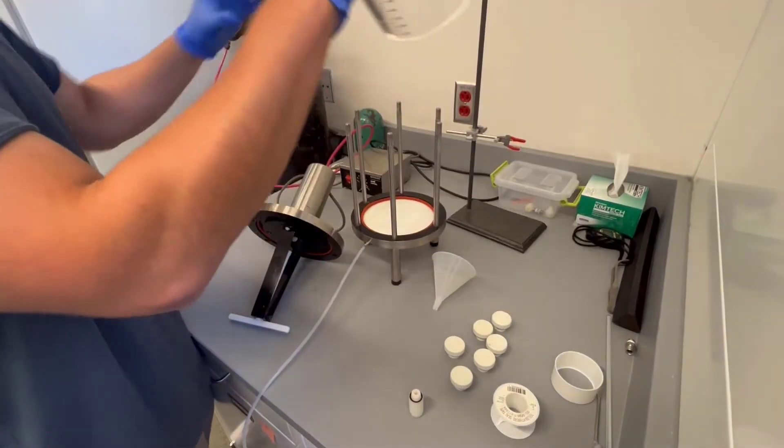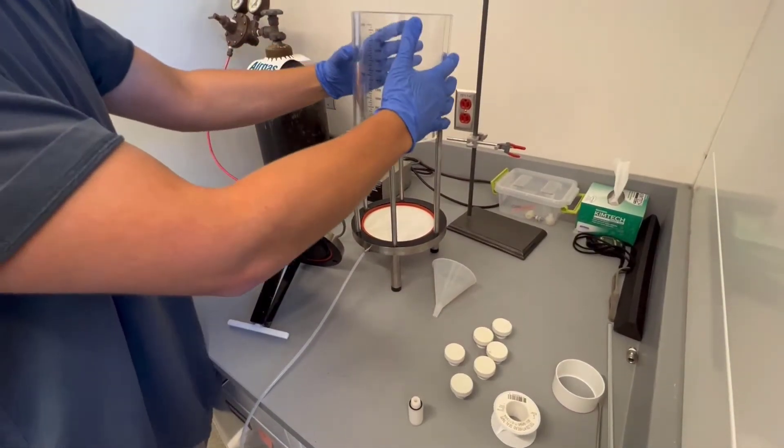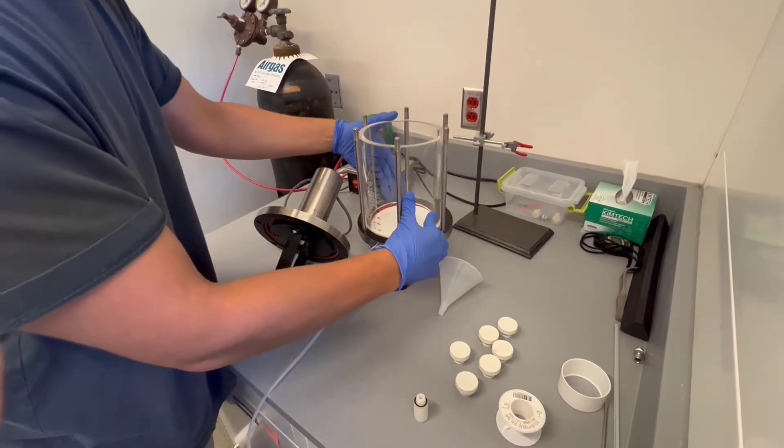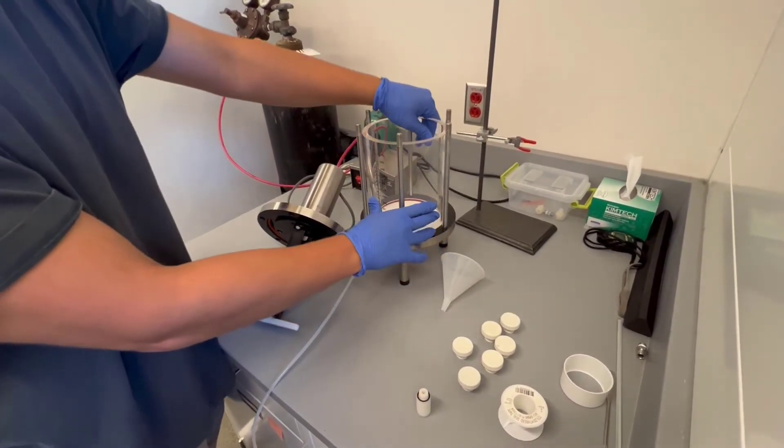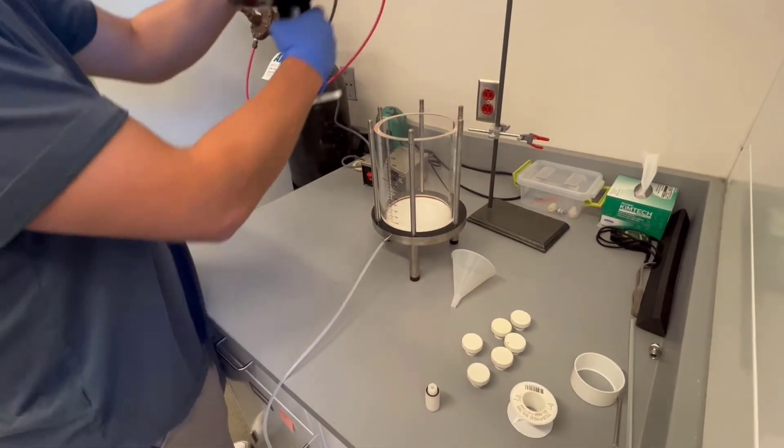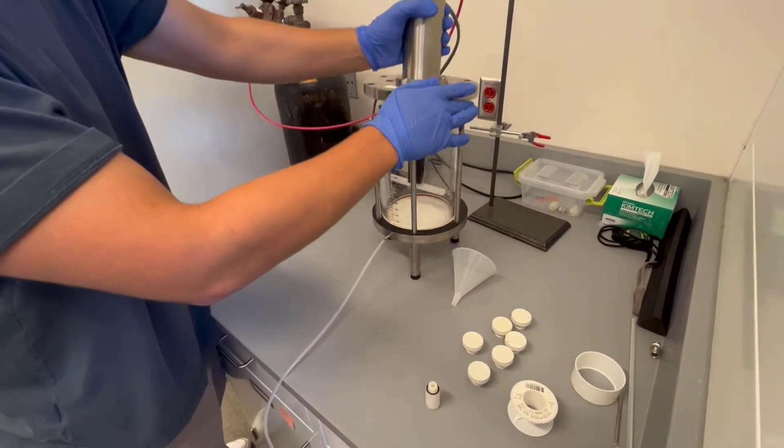After that, you're going to put your actual glass cylinder on there to secure this and it will lay right on top of that O-ring pretty comfortably for you. You should be able to feel it when it's fastened, now it's not really moving there. Then you're going to get to put your top on here that's connected to the stir.